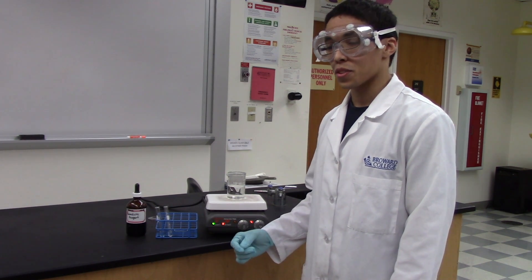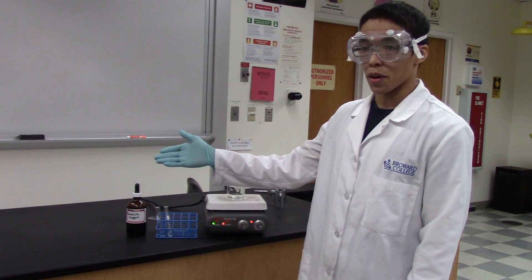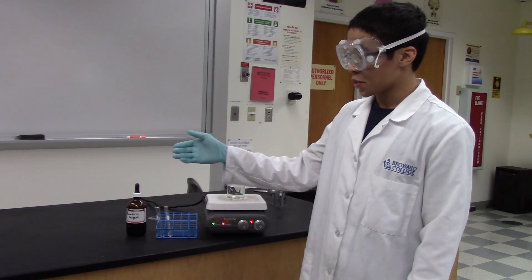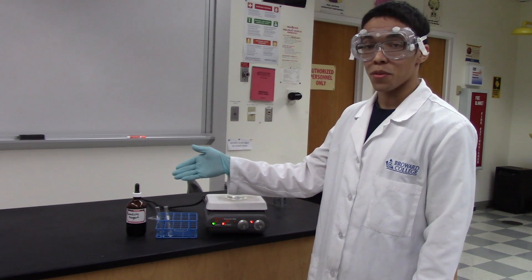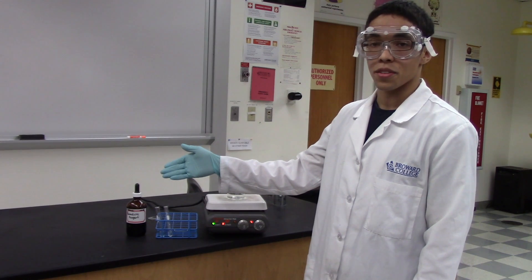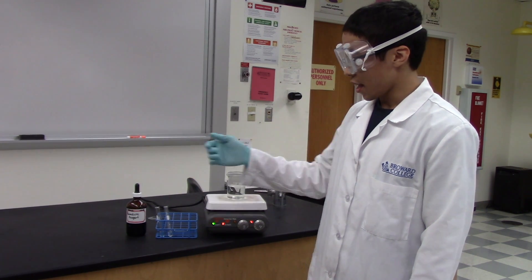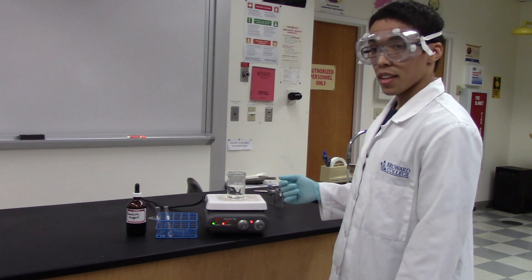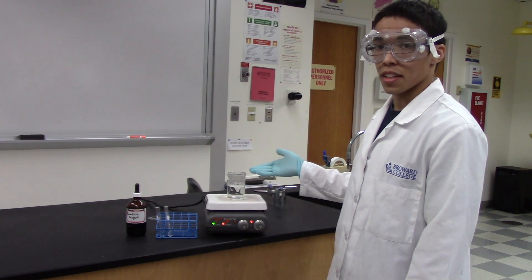Benedict's reagent is used to test for reducing sugars. In this example, we have Benedict's reagent in a drop bottle, two test tubes — one containing a reducing sugar and another containing a non-reducing sugar. We should label yours in lab — a hot plate that is currently turned on, and a beaker containing water.